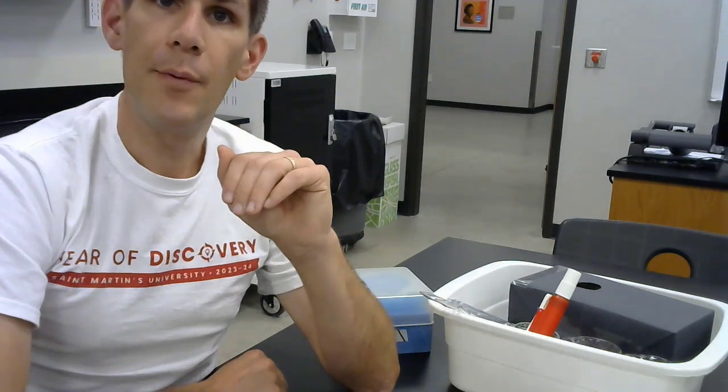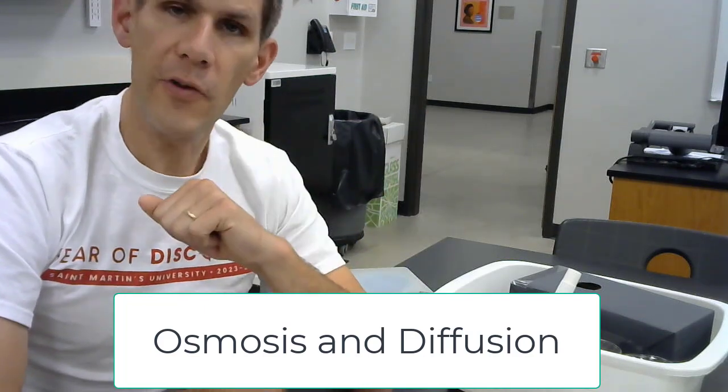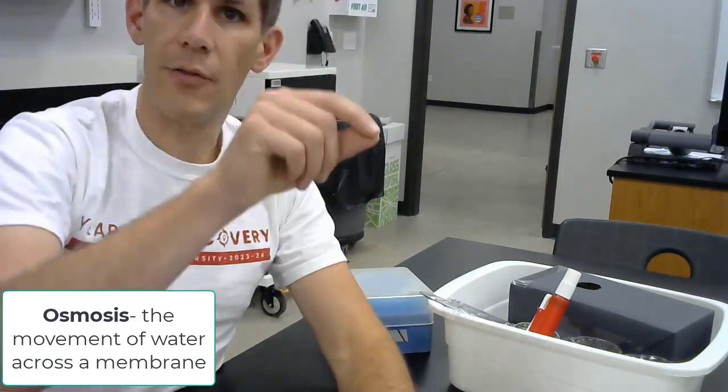In this week's lab, we are going to be doing two things. We're going to be looking at osmosis and diffusion. In the first part of the lab, we are going to be looking at osmosis. We are going to cut potatoes into tiny cubes and put them into three different types of solutions.